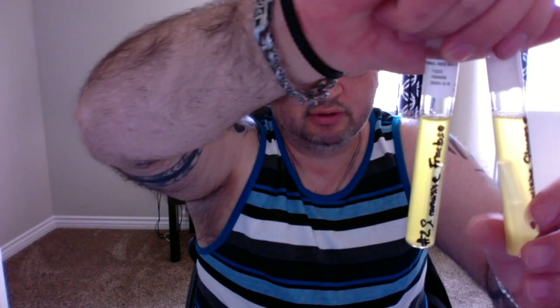So, since I used only 2 microbes, S. cerevisiae and S. epidermidis, and all 3 of the S. cerevisiae tubes, which are here, fructose, mannitol. Oopsie, I want to turn this one, or this one, I should say. Whoa. Didn't break, so that's good.